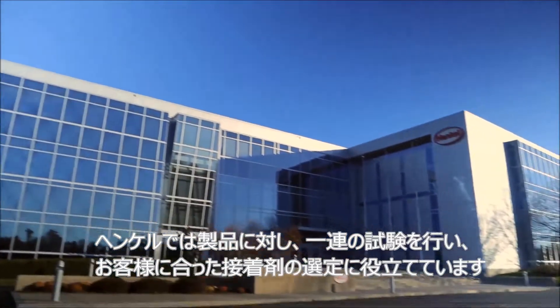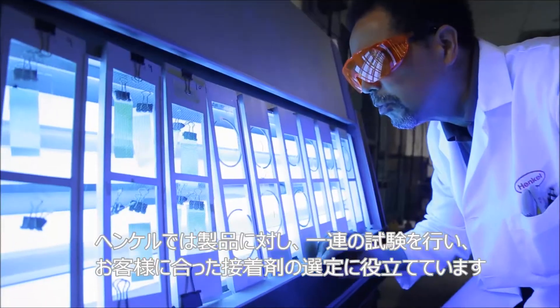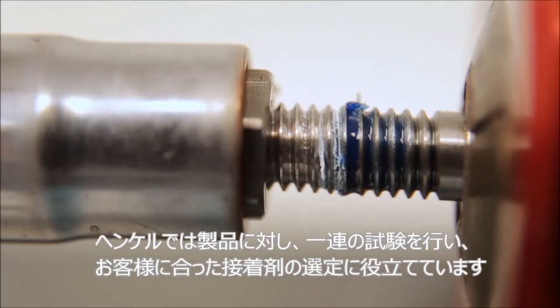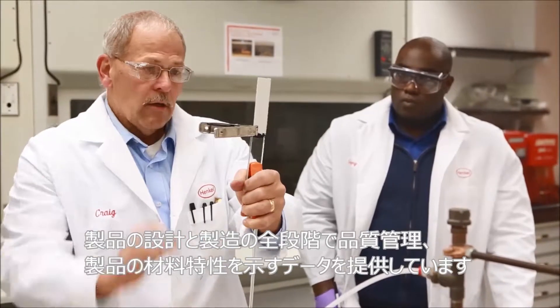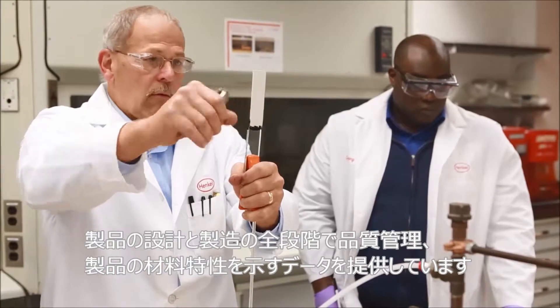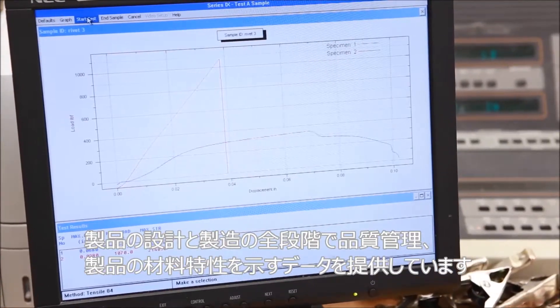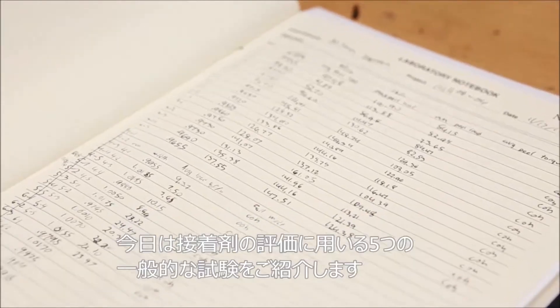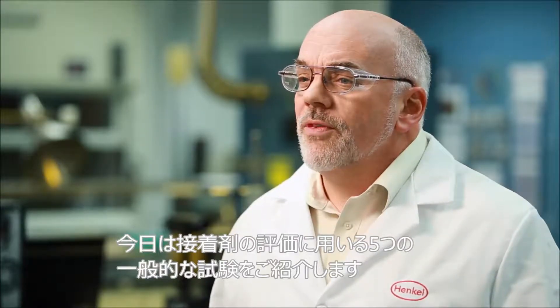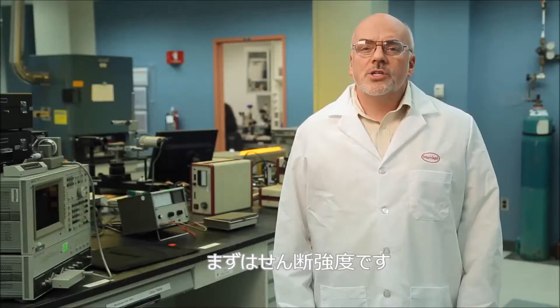Here at Henkel, we run our products through an array of tests that help determine which adhesive solutions are right for our customers, allow for quality control at every step of product design and manufacture, and provide data that describe the material characteristics of our products. Today we're going to show you five of the most common tests we use to evaluate an adhesive, starting with shear strength.